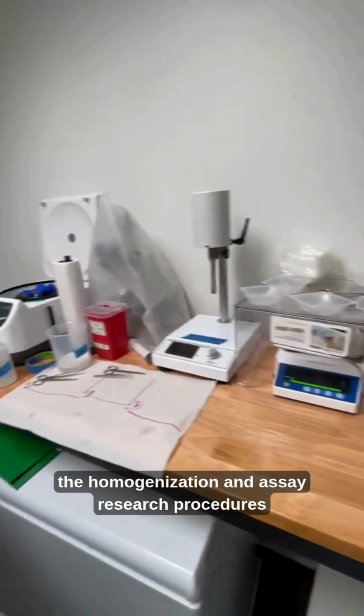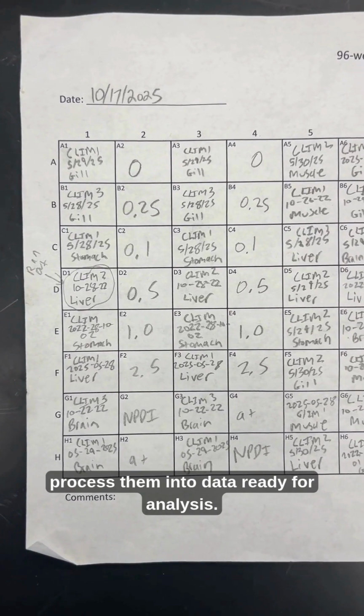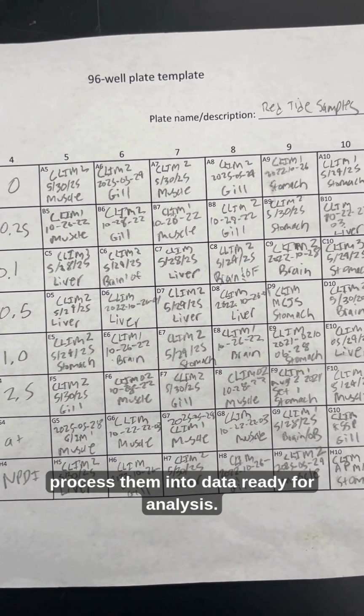In this video, we'll be covering the homogenization and assay research procedures we use to take our dissection samples and process them into data ready for analysis.